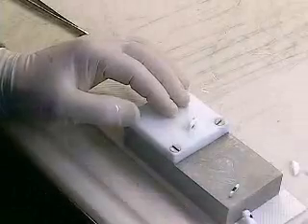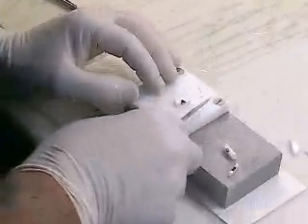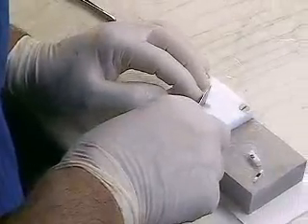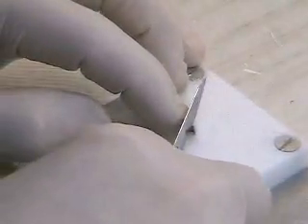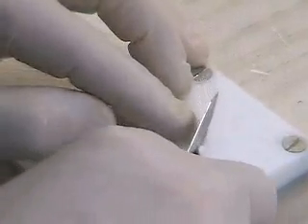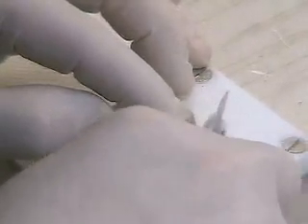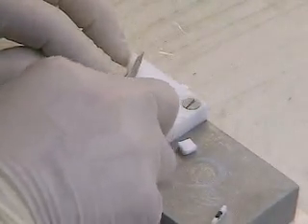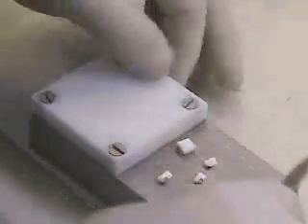As I cut each piece, I'm going to put it down to stay cold on the freezing griddle. When you're cutting these small, very flat pieces like this, it's good to push forward with the knife so that you're not going to dislodge the tissue from the embedding medium. And again, that's another reason why we want to make sure that's nice and cold. Notice I go forward a little bit, and now those go back to the griddle.